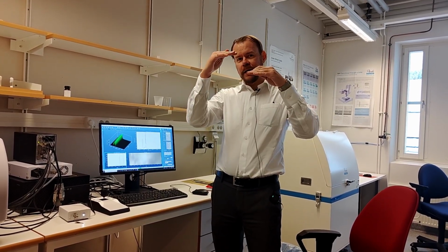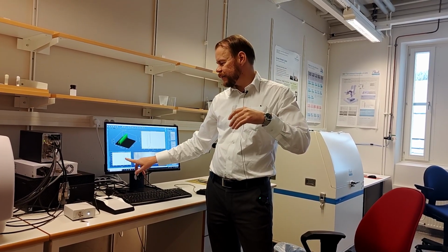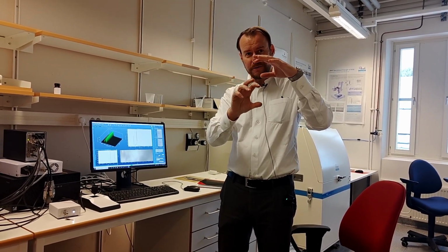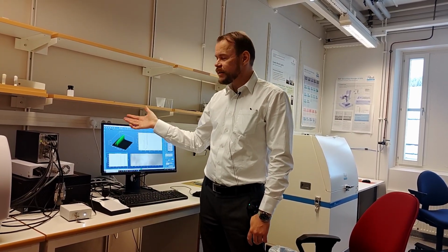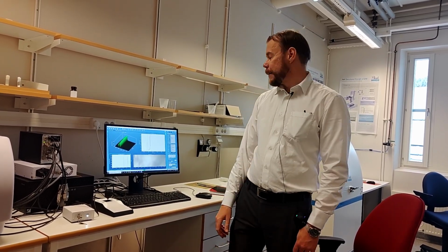And then we start coming into the material, and then it's like half the laser is inside the material. That's why we get that improvement. And then after a while, the whole laser is in, we get the whole volume of collecting signal, and then it of course increases. And this is what we can expect for a sample that is 100% the same chemical all the way through, and so on.